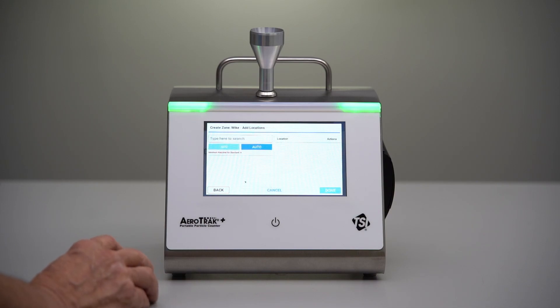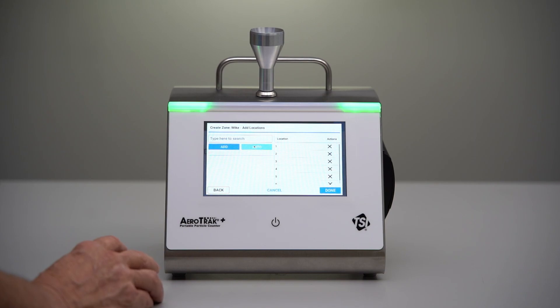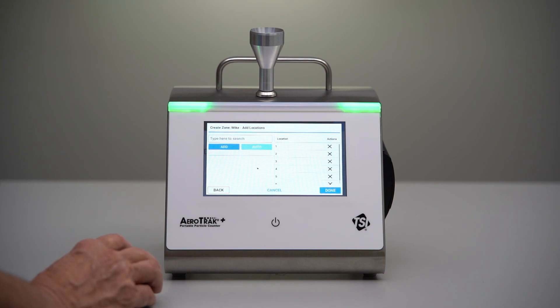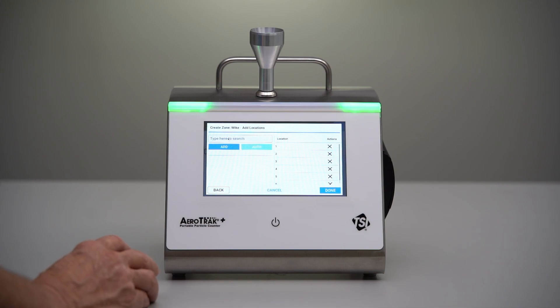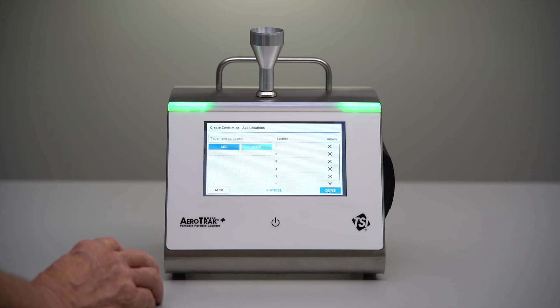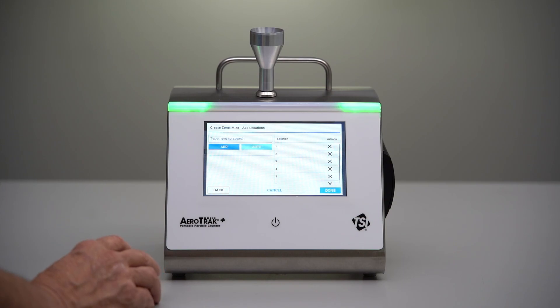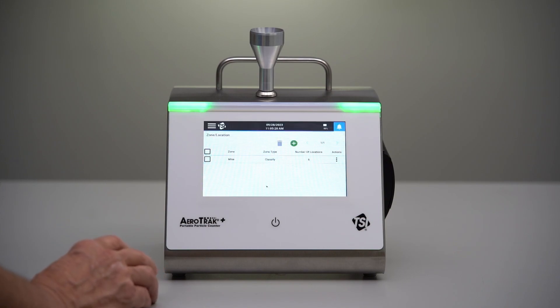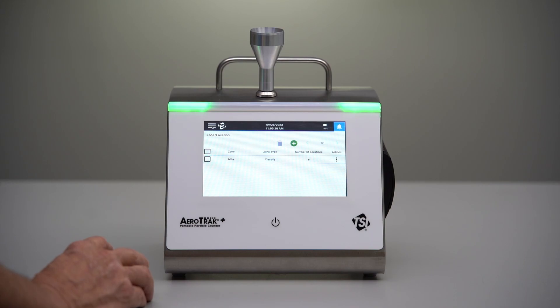The only thing left to do is to populate the number of locations required by the standard by clicking the Auto button. We did that and we're done. We can add a prefix to these before we click Auto if we want to, but we have all the locations we need, so we've basically already fully created the new classification zone according to the formal standard.